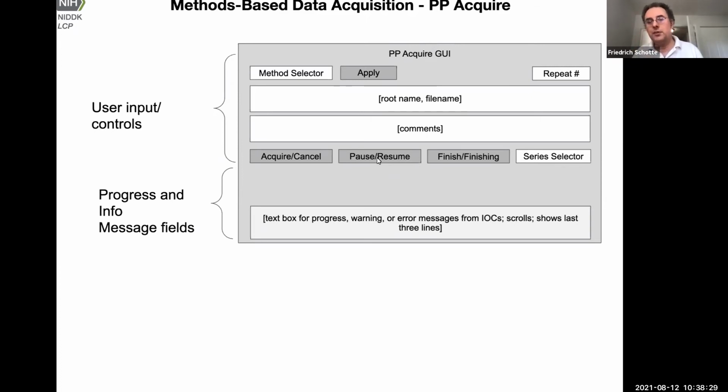And some other options Philip found useful, for example, you can say, oh, it's taking too long. You want to finish early, but you don't want to cancel immediately. You want to finish the current time series or current temperature series. So it does a nice smooth exit. So this is why you have these controls here. Or you can add more repeats to it at the end. So now it's time for the demonstration.